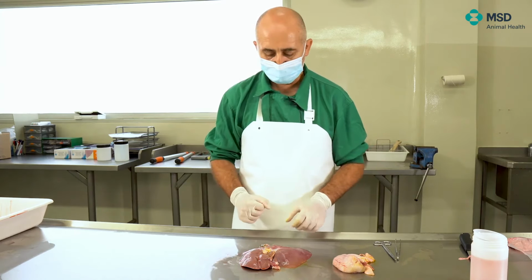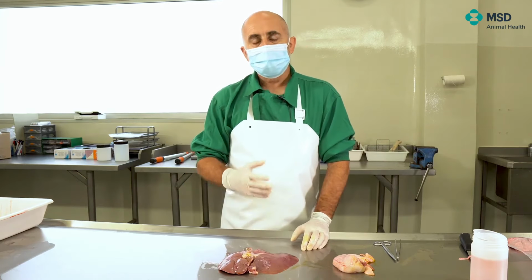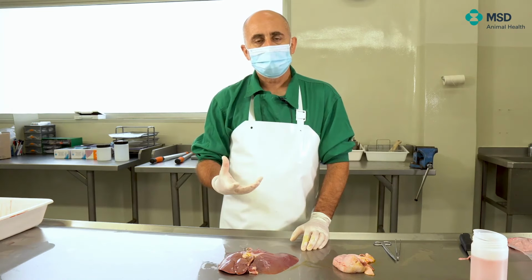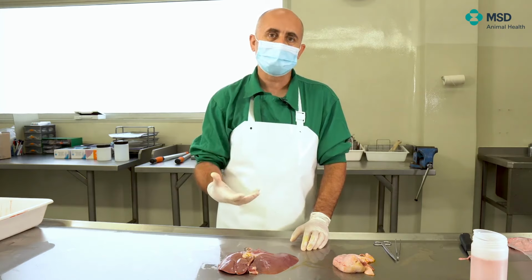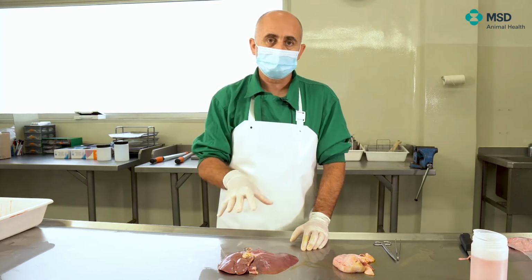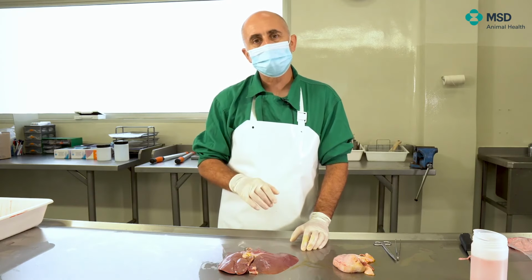Then, what about the liver? In fact, in the liver, there's not a lot of pathology that can be ascertained grossly. In most of the cases, we have to go for histopathological analysis. So for that reason, fixing samples could be of interest. But there are some issues that could be of interest to be analyzed.